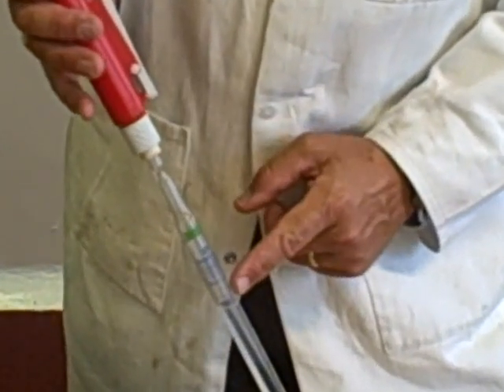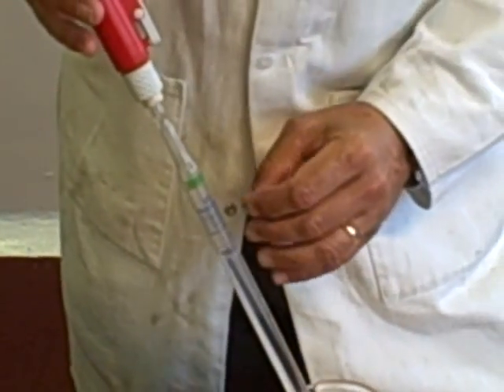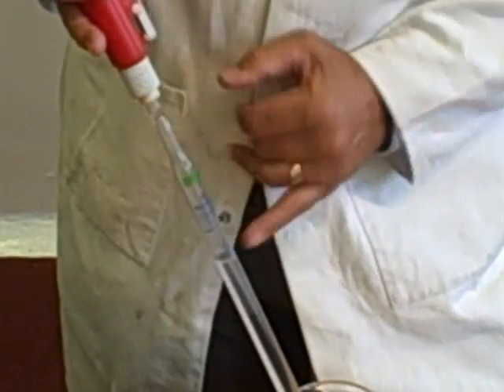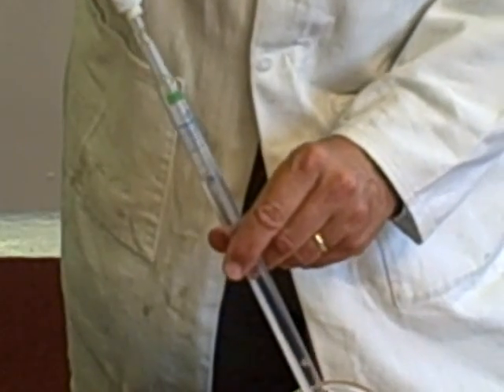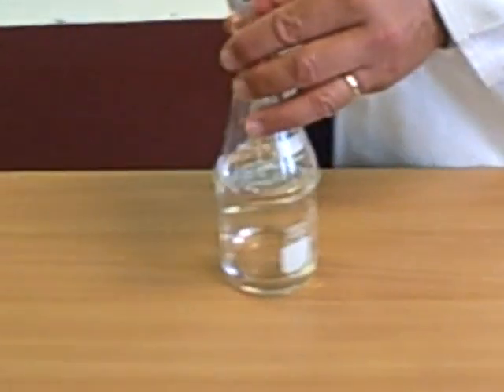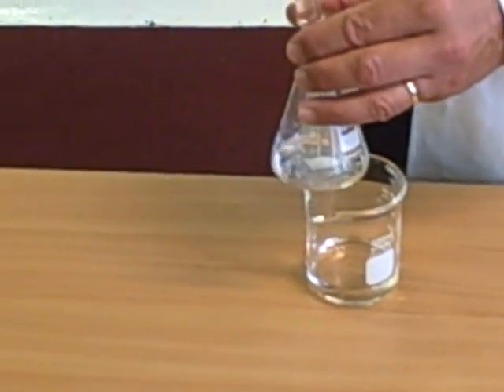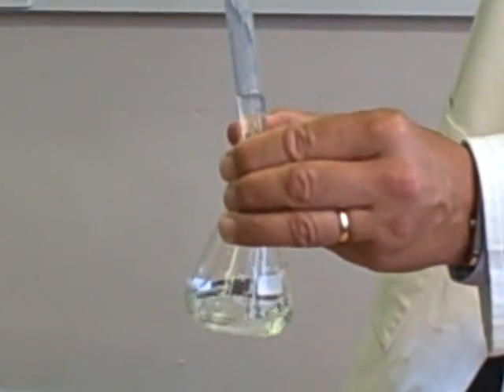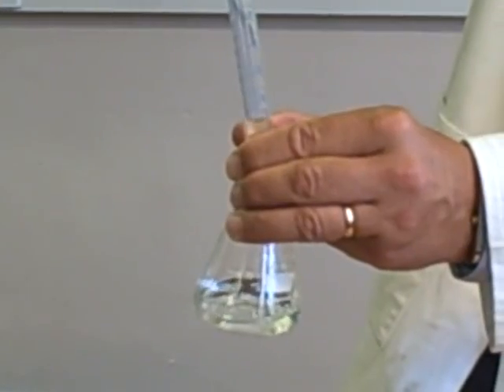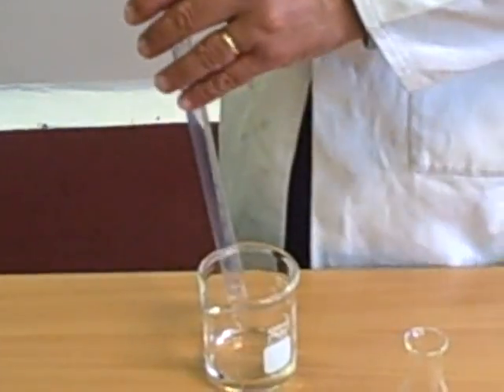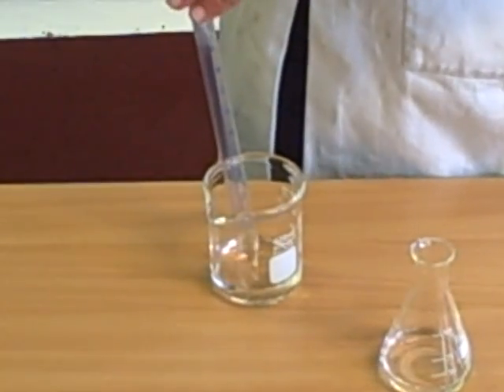So what you will have to do is, when you do this, you will have to add, after you've got to there. If I press that, that comes out, and if we look here, I'm going down to 25. I've gone down to 25. I haven't put in 25. I've put in 23.